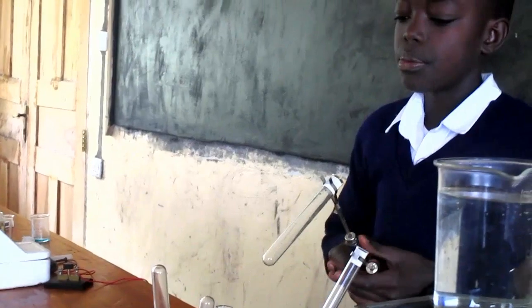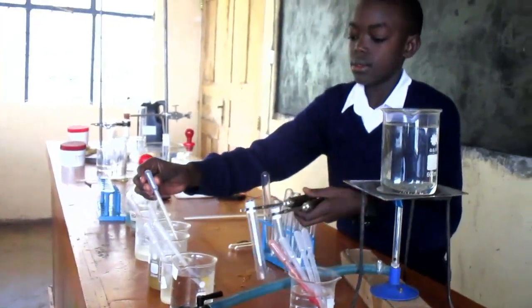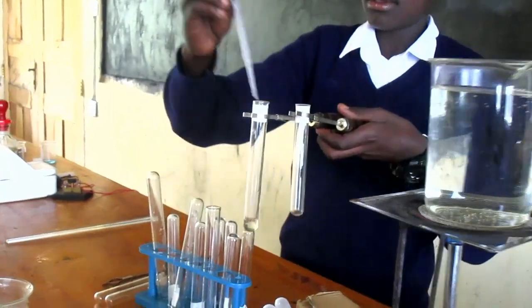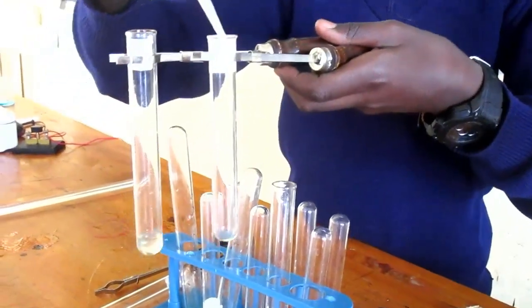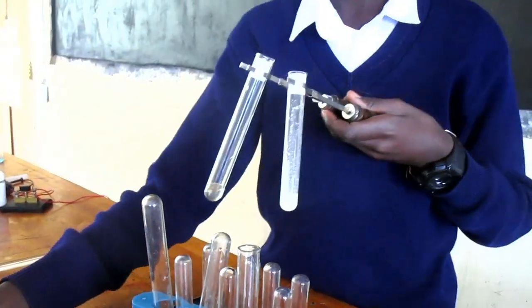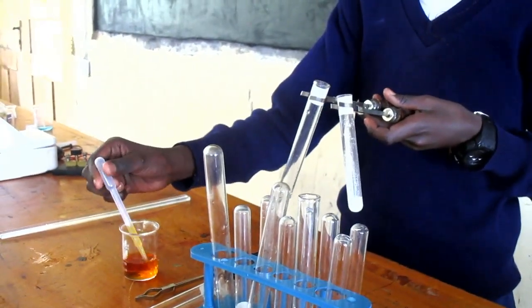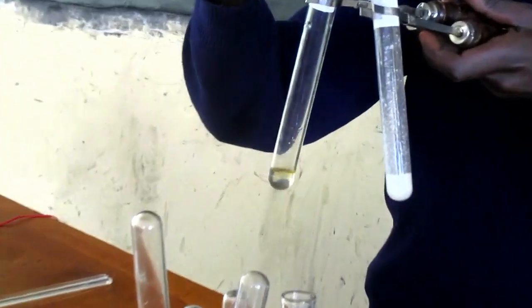After that, we are going to take sample C and sample B, add a few drops of iodine solution to the food samples, and then observe the color changes.